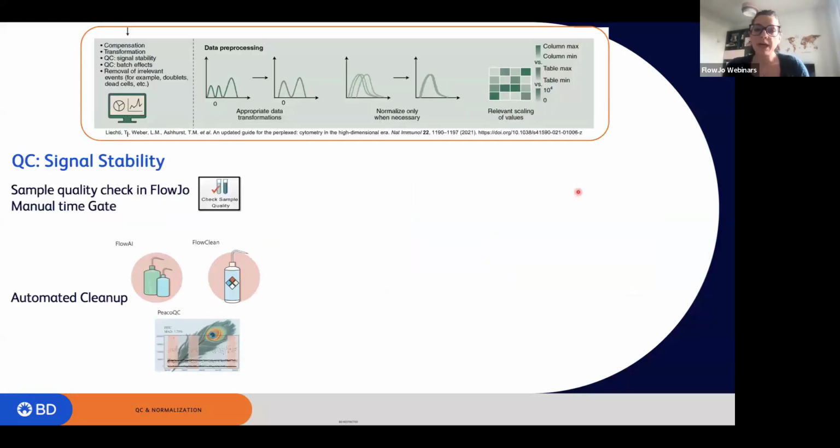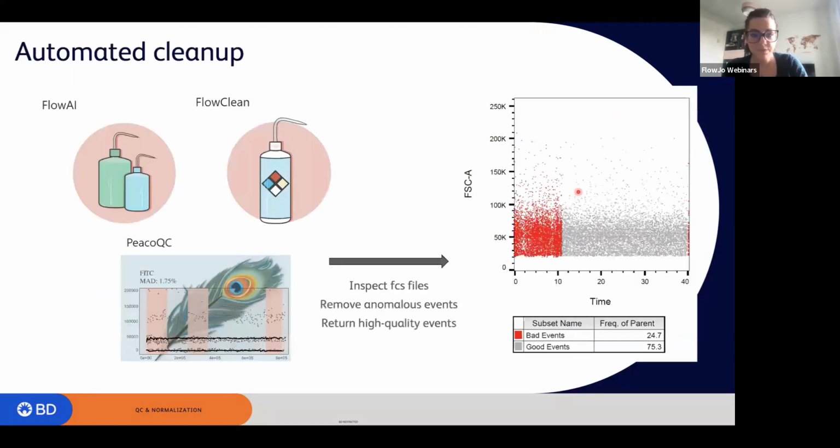What about automatic algorithms to clean up the samples? For that, we have FlowAI, FlowClean, and PeacoQC. These are three algorithms available as plugins for FlowJo. They are able to inspect the FCS files and remove events which are basically anomalies, and what they give us back are high quality events. This is the same file as before, but cleaned up automatically by using one of these three algorithms.